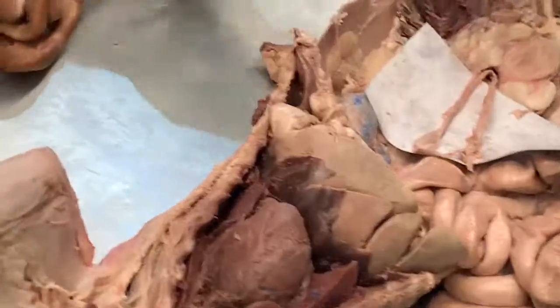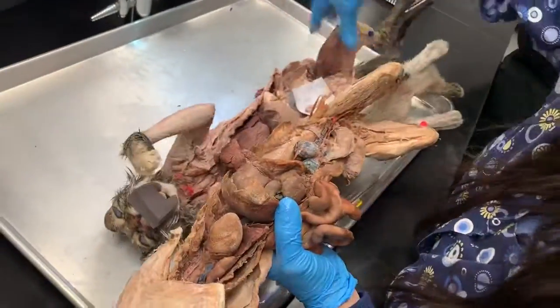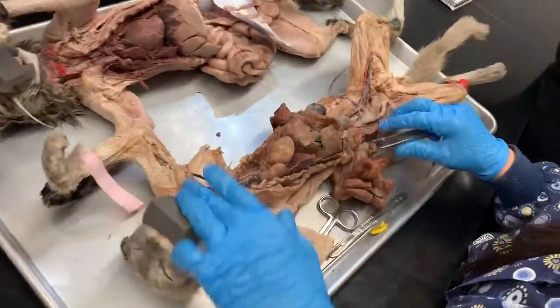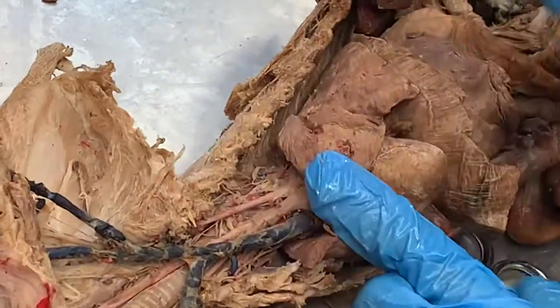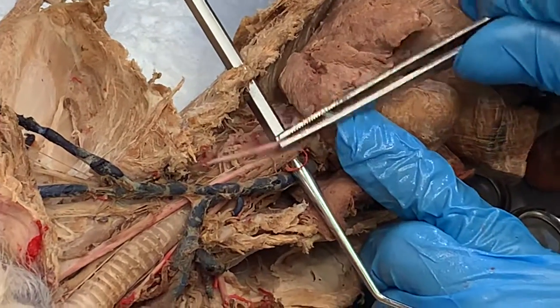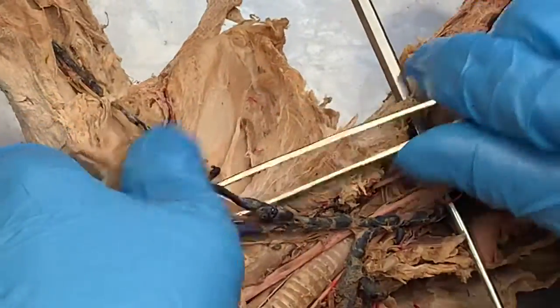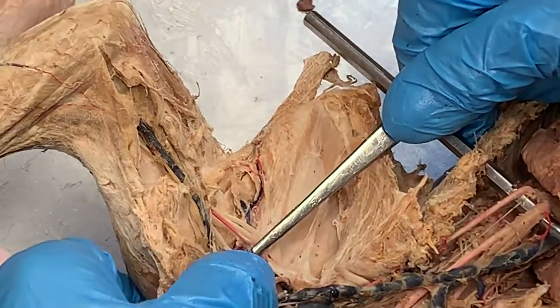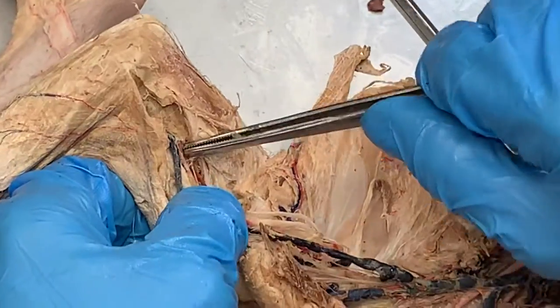Now I'm going to switch cats and we're going to look at blood vessels on this other cat. We already started the heart. So here's the heart. Coming out of the heart, we see two vessels. This would be the left subclavian artery. That's gonna go up and over the ribs, and I'm gonna kind of fake it here because this is broken, to the armpit area where it's the left axillary artery, and then way far down in the arm, we would see the left brachial artery.